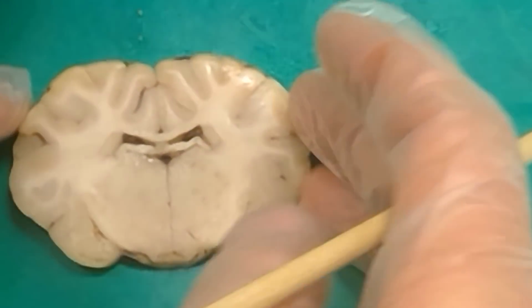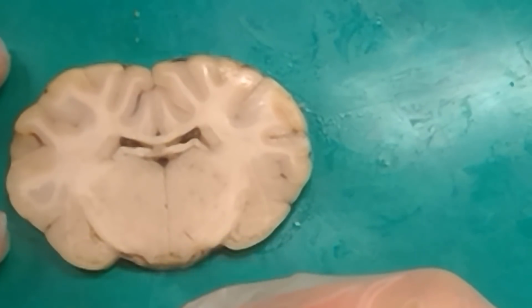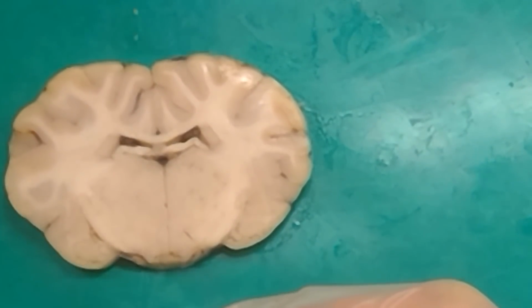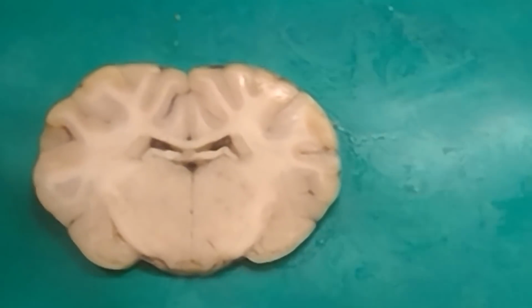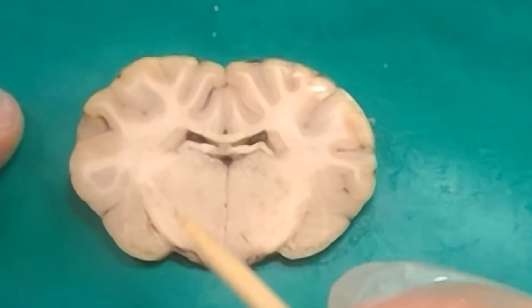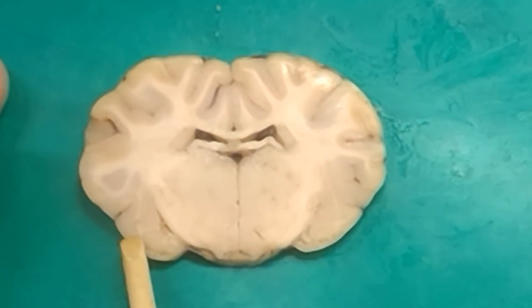Okay, just one more time. We know that it's hippocampus, not amygdala. I can see a white line going through right here, like a white curl. If you're looking at amygdala, it's just straight gray matter there. But that looks like a teardrop. It does, but if you look, I don't know how great this camera is, but there is a white line that's going through right here.